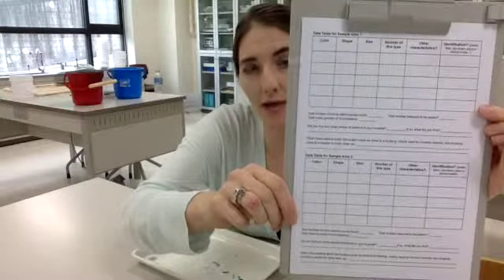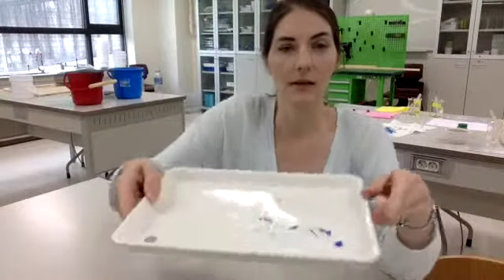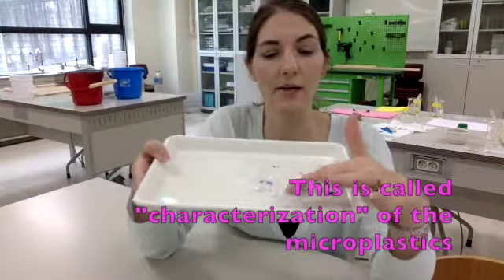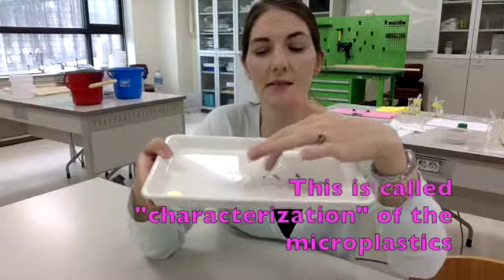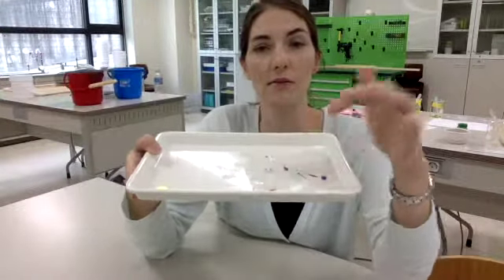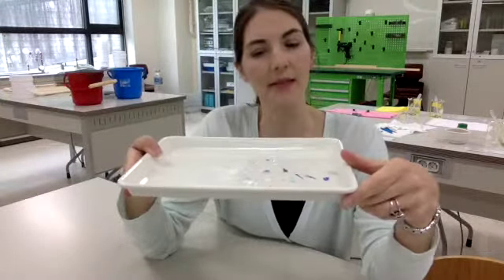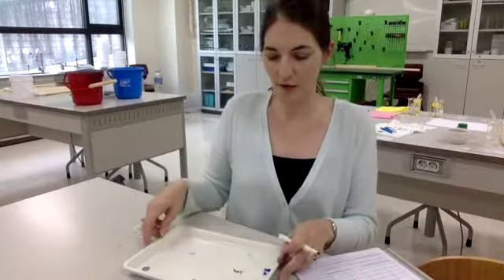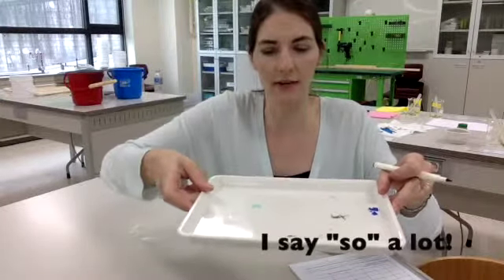So we need to start filling out our data table. First, let's figure out what types of plastics we have here. Well, I have dark blue, some light blue, some polystyrene, some more light blue, some plastic bags, and a little piece of something I actually didn't put in there, so that was there originally. I'm going to count these up and separate them and figure out how many I have of each different type. Okay, so I kind of separated it out. Again, this hopefully is way more than what you're actually going to find.